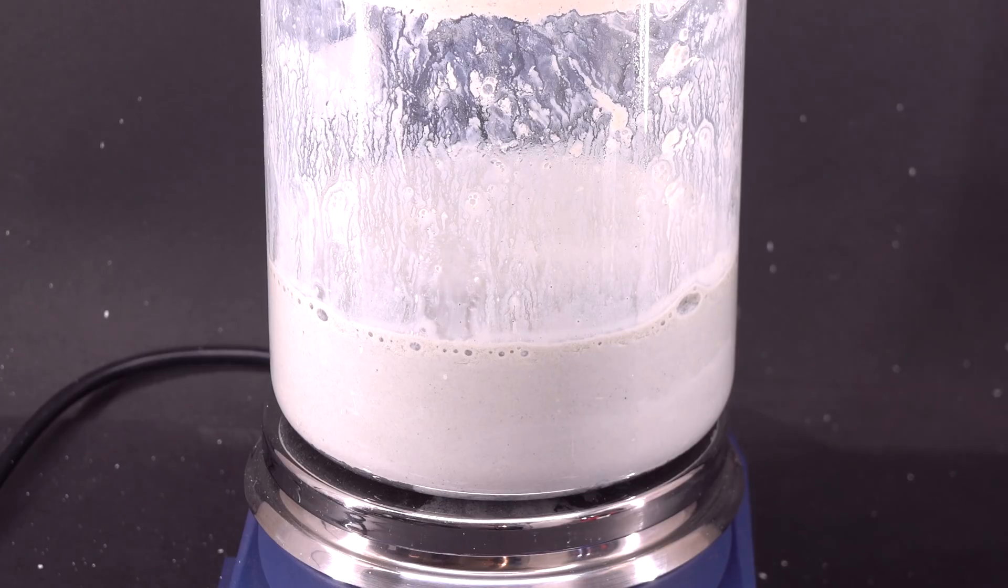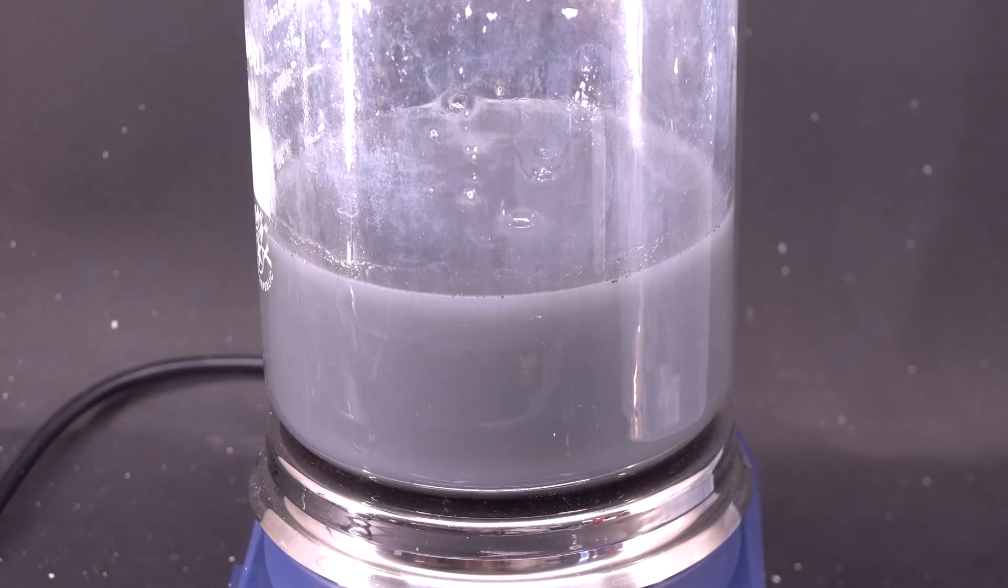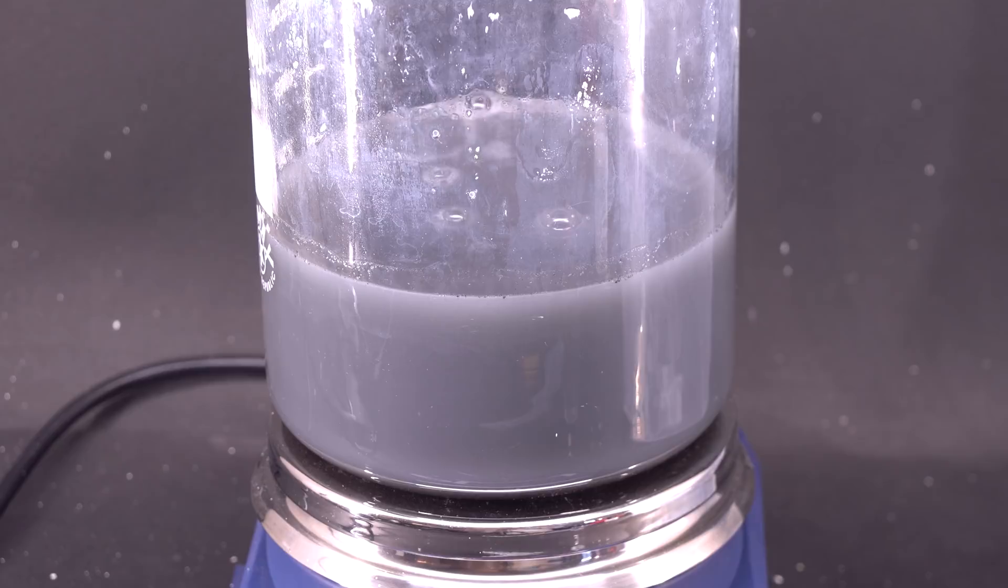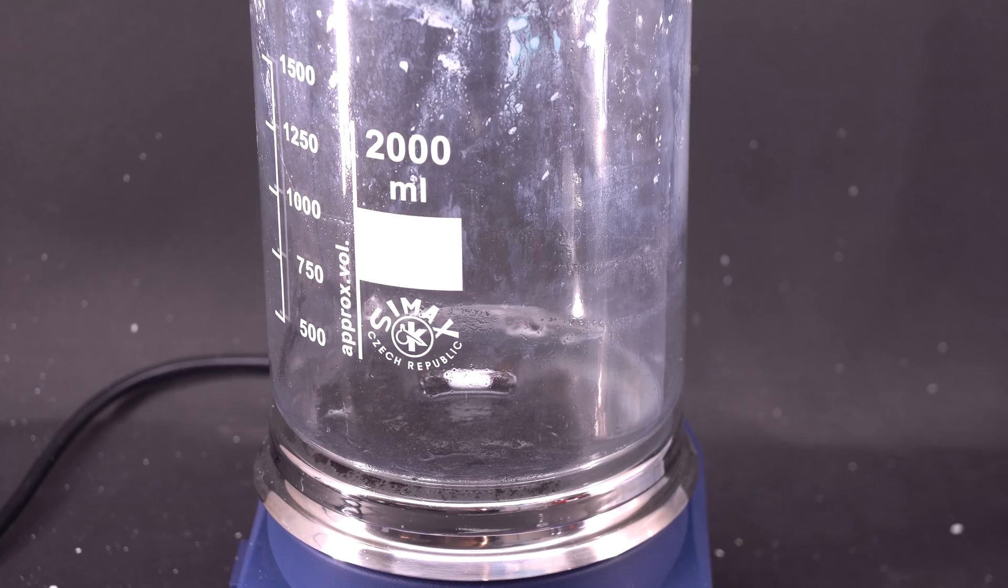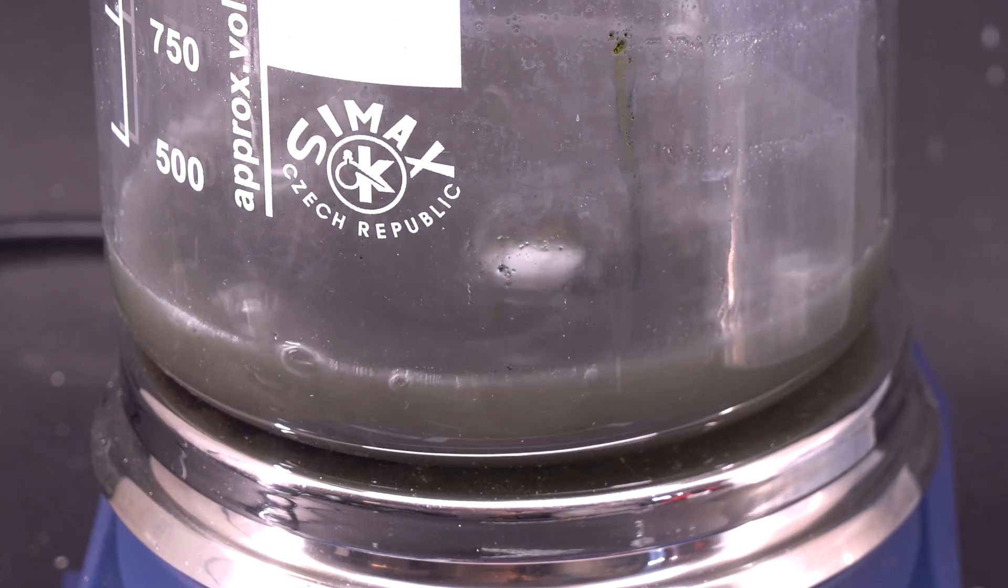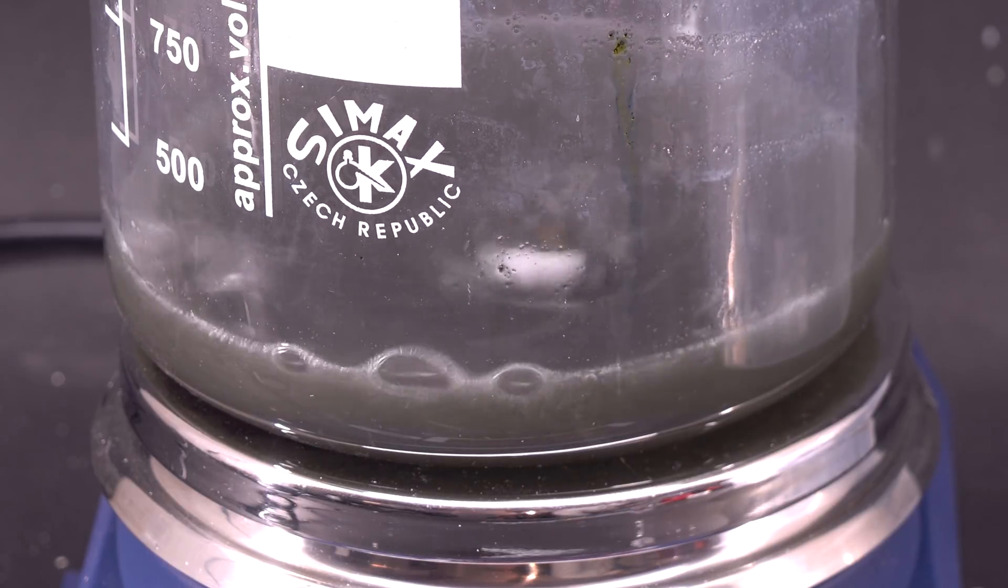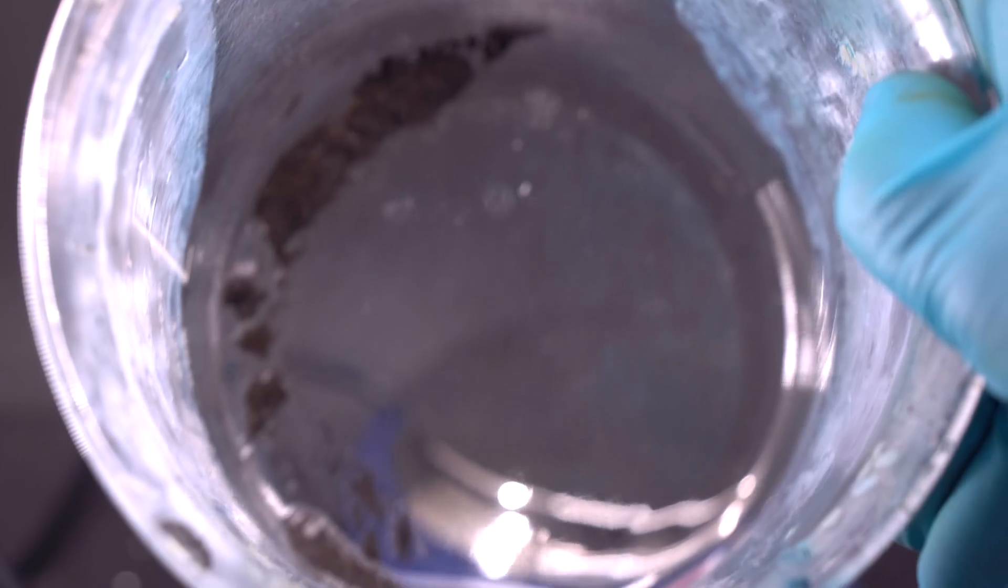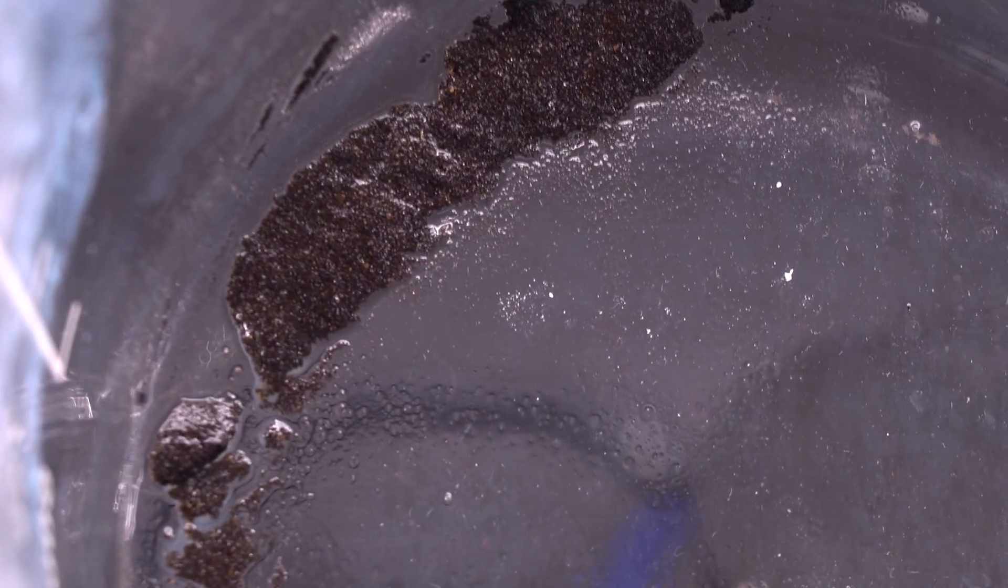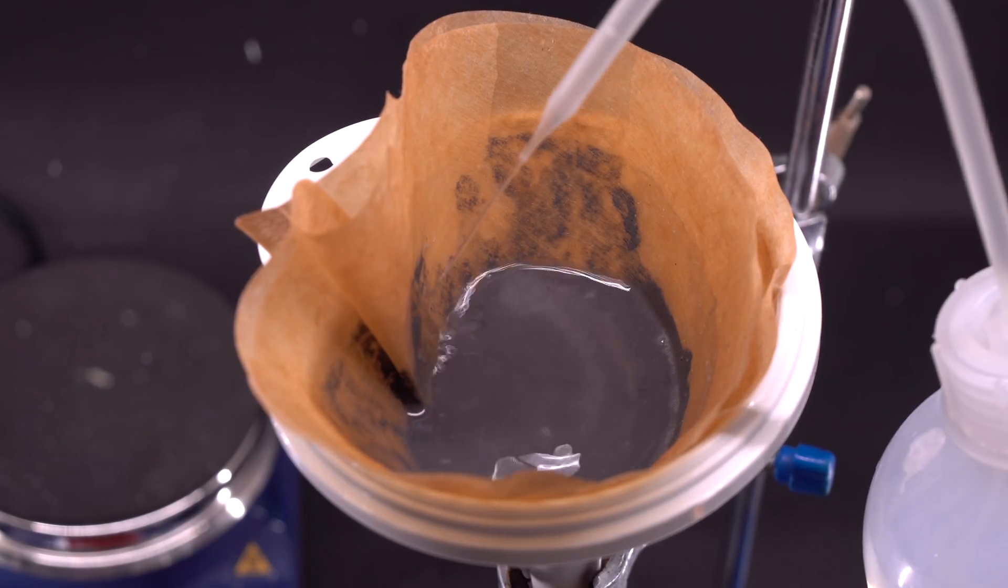I'm pouring in some concentrated sodium hydroxide solution. Thus this oxide of zinc should dissolve. After everything has dissolved and settled, I poured out the upper layer of the solution and added some concentrated hydrochloric acid in order to wash away vestiges of zinc powder. After dissolving zinc and rinsing several times with dilute hydrochloric acid, there is some sediment left on the bottom. Apparently this is gold with iron impurities. I'm going to filter and dry this sediment.